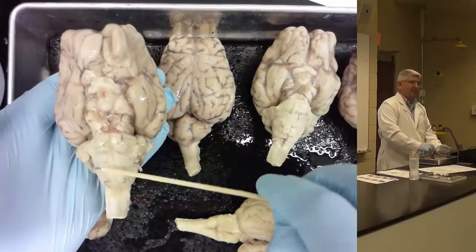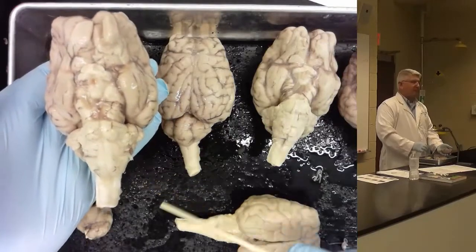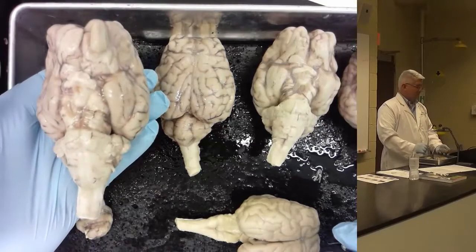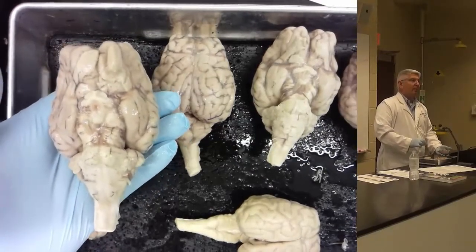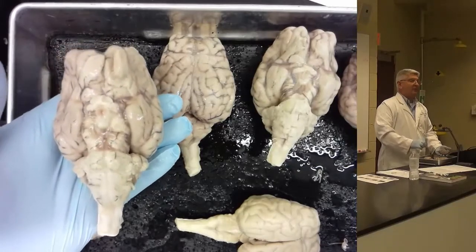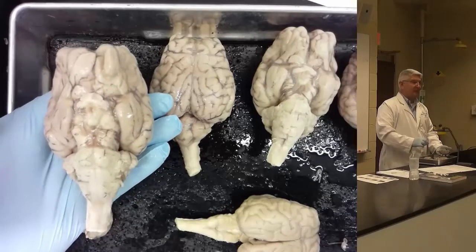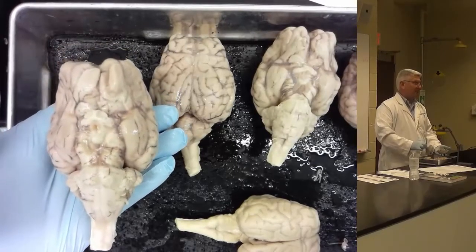We can't see the cerebellum except for the flocculus over here. So the first thing is to orientate: am I looking at the top or the bottom of the brain? I don't think there's any structure today that you can identify from both the top and the bottom. So it's either a top structure or a bottom structure.